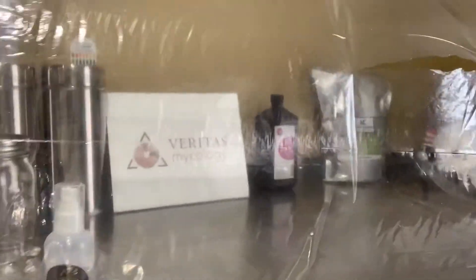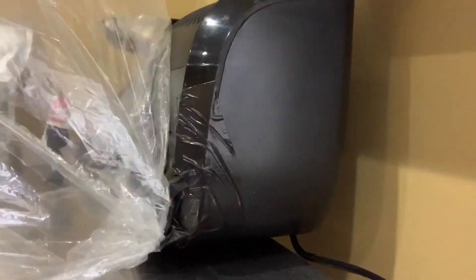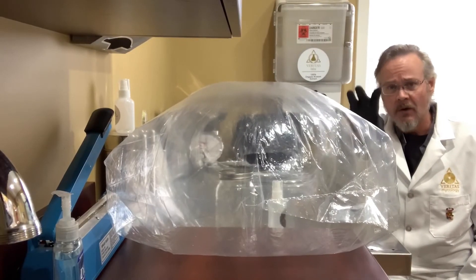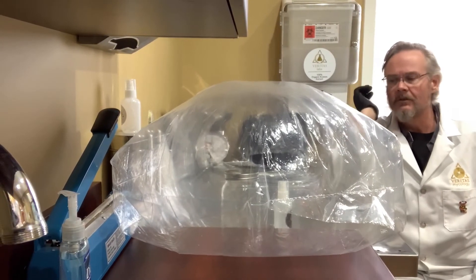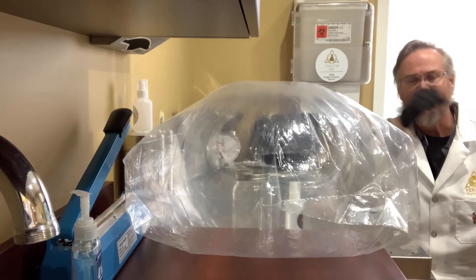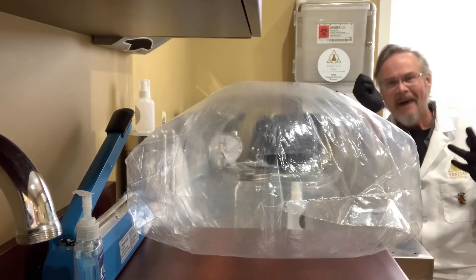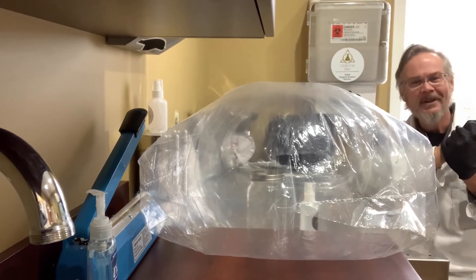There you go — you can see there's the slit I cut out, the X-shape, and it kind of blows itself open. My arm holes here for me to reach in and work through. This is a really fantastic way for you to start working with mushrooms at home. You can do grain transfers here, work with your liquid cultures, do your agar plates here. If anybody wants to build a big monster one with like a bounce house attached to a giant unit, I will love that.